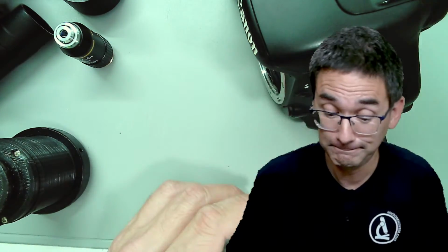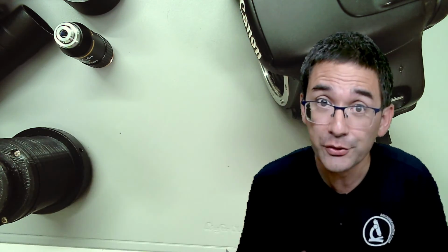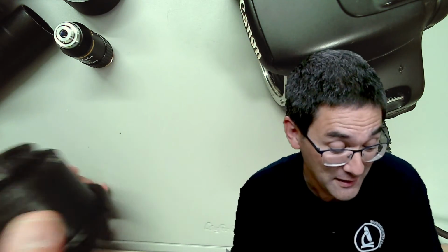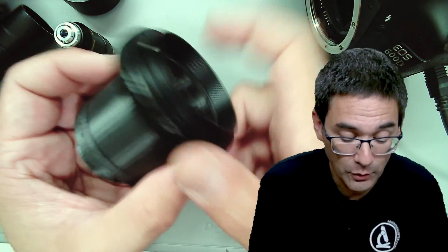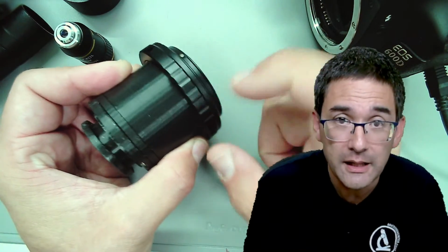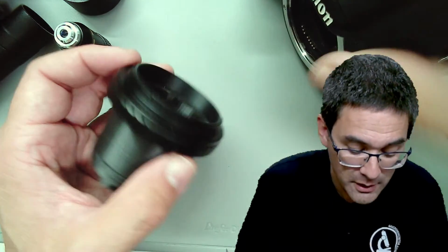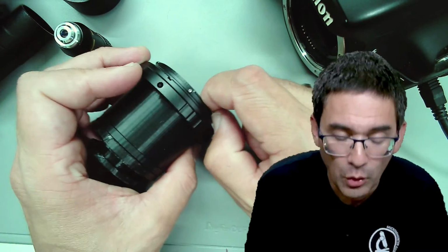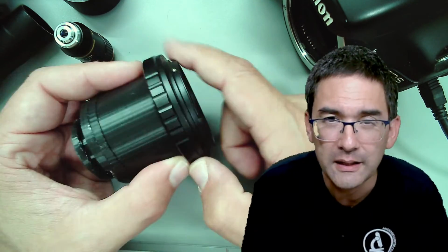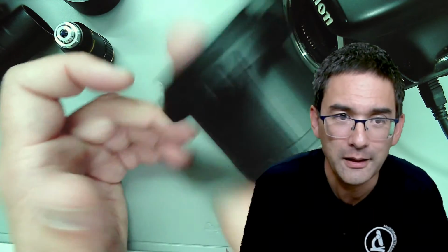And I have done that. Okay, I'm going to show this to you. And I tell you, I do not understand why the company doesn't provide something like this. This is a 3D print that I made. It's just a tube. And over here, this is made of metal, a T2 adapter ring again, because I want to connect it to the camera. And 3D printing all of these things, it wouldn't have been strong enough, and would have been too complicated. I'm not a good designer, so I'm just able to design a tube, okay?